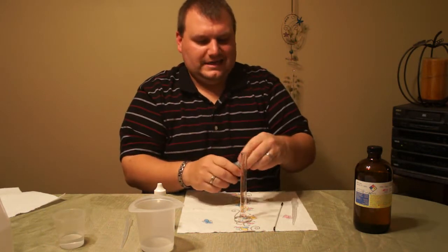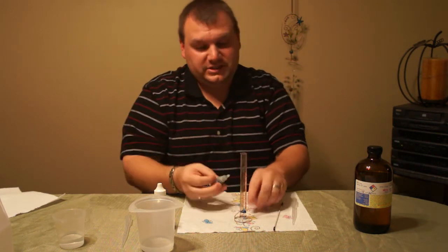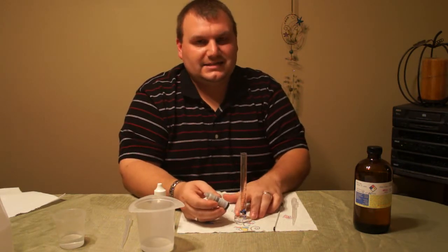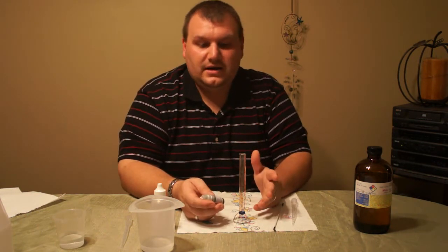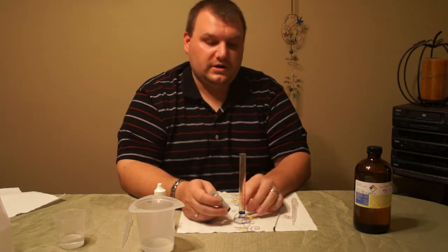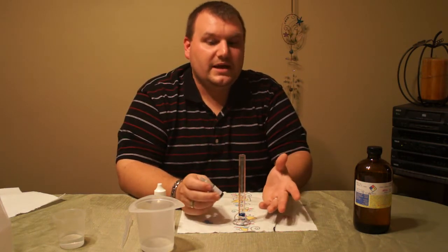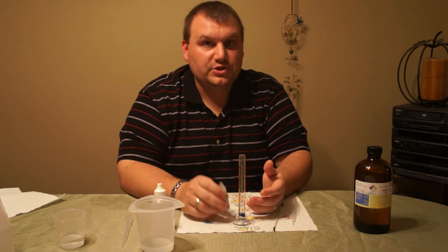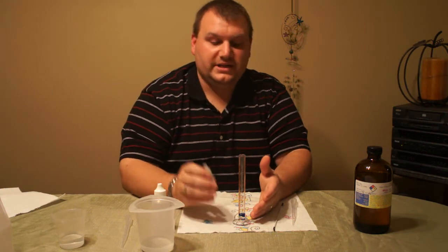You want to add two drops of blue. I like to add three or four drops just because it makes it easier to see the color change. People ask, can you use more? Bromothymol blue is actually an acid in itself. However, based on my experience, I've done the test with 8, 10, 12 drops and it has not thrown the results off that much or at all. So yes, you can, but don't overdo it. If you're testing high strength, let's say 100 milligram, then you will want to add like 8 drops or so, because so much acid gets in there and it dilutes the solution, making it hard to read the color change from blue to yellow, especially when it gets near the yellow.